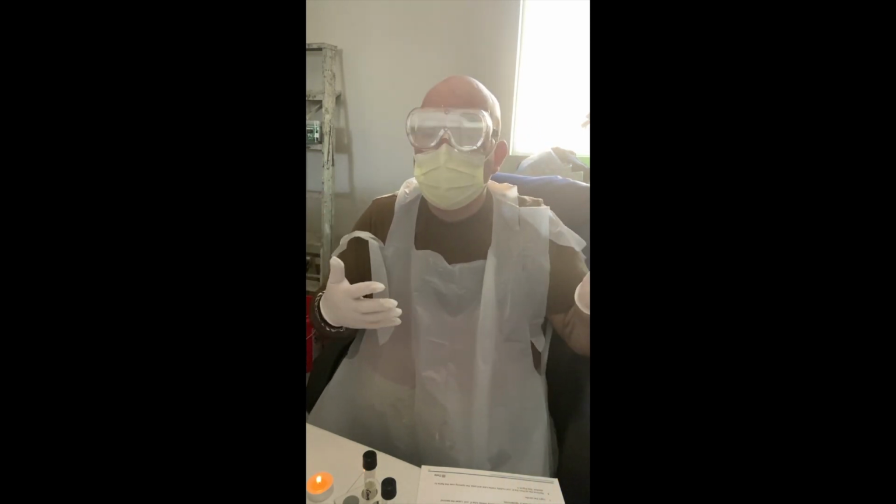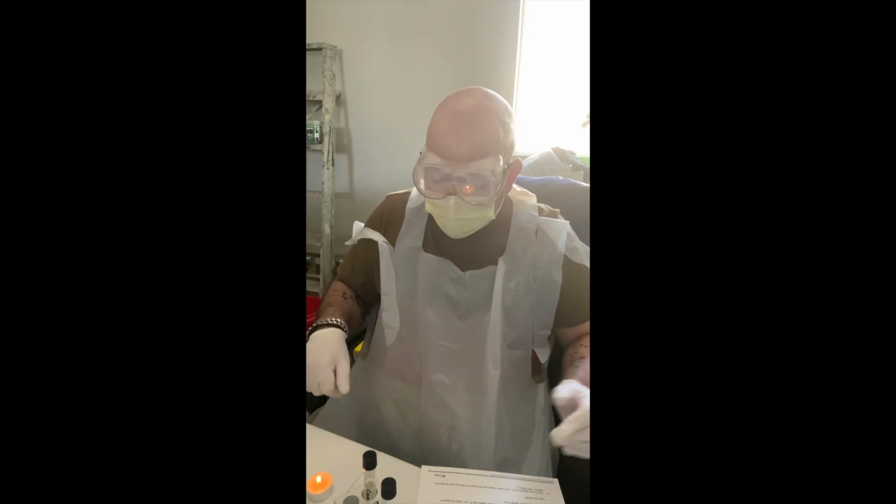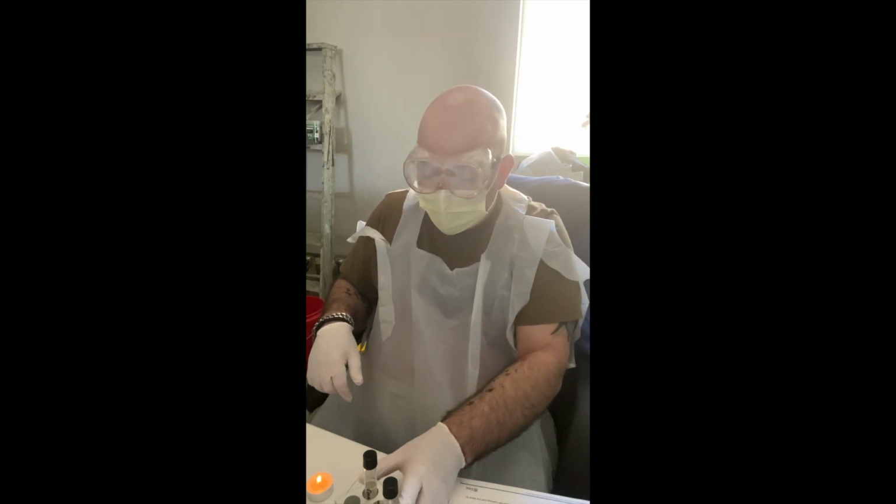So after I stab them, these will go into my incubation location, which is my dark closet in my home office for 2 days. So today is Wednesday, so around Friday afternoon, Saturday, hopefully we'll have some sort of growth. Okay, so with that being said, I'm going to get started.